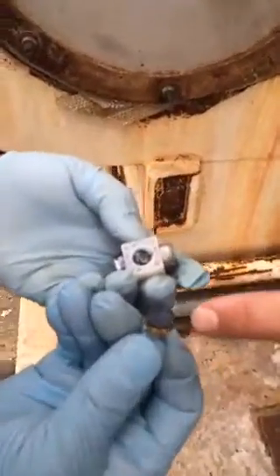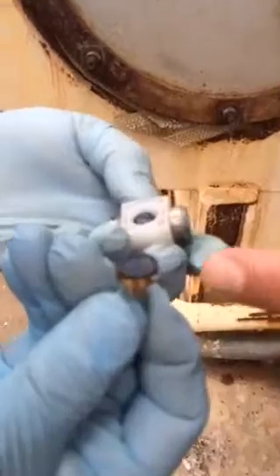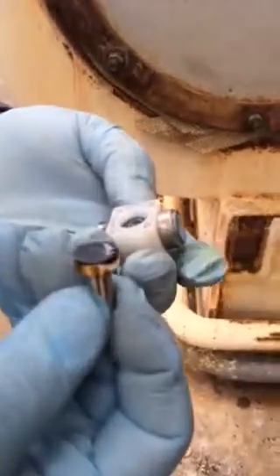Look at that right there on this back side of the seat. There's a bunch of chemical stuff. Maybe if that's cleaned up, and that inside, it might work. That's probably why it's doing that. Too bad they don't sell a little rebuild kit.